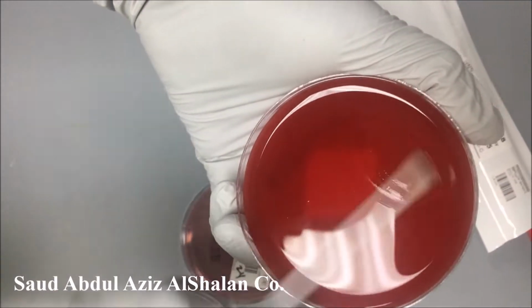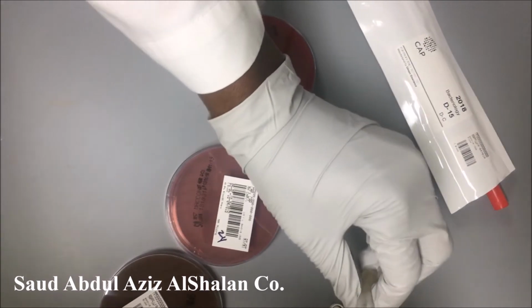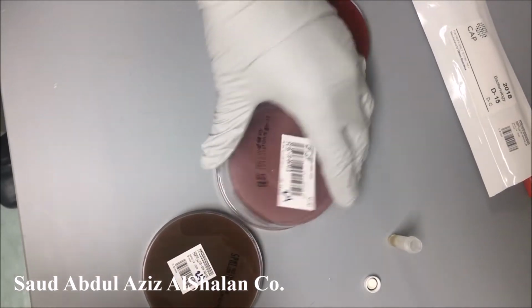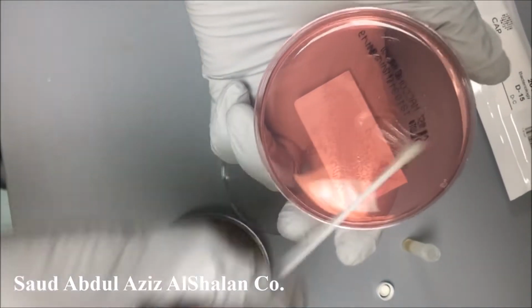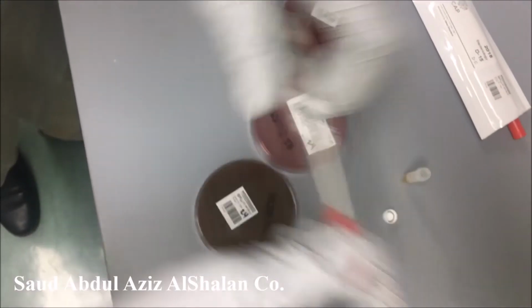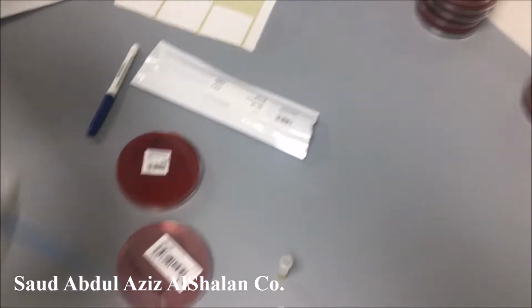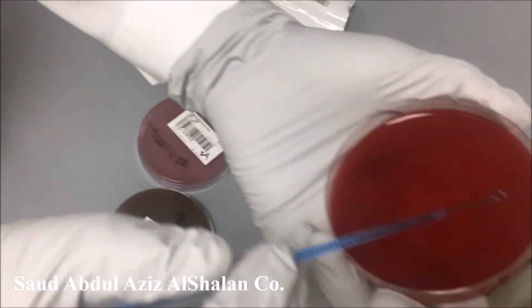As we said, we have 2 blood agar plates because one of them is going to be incubated anaerobically. After we distribute the specimen on all plates, we are going to do a normal streaking.